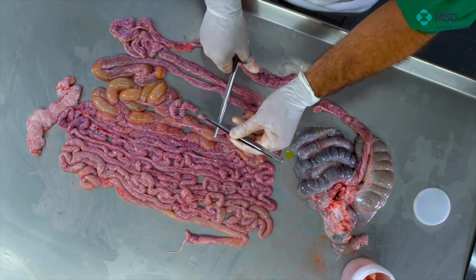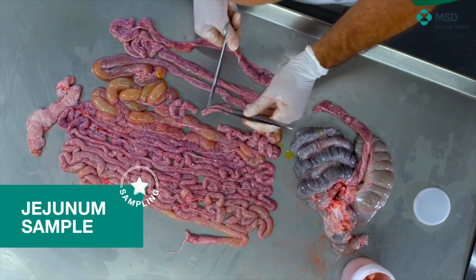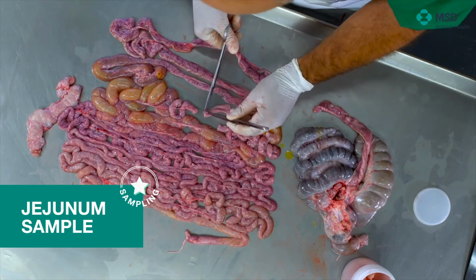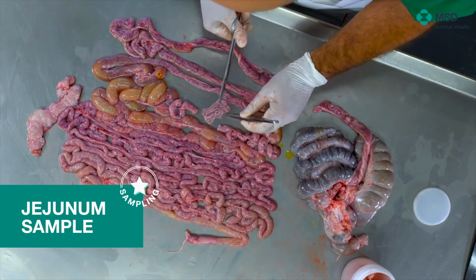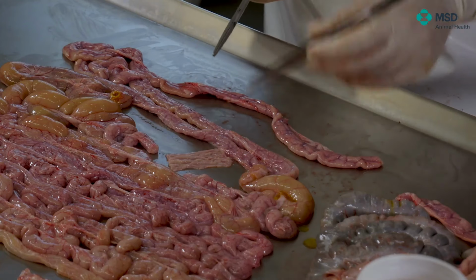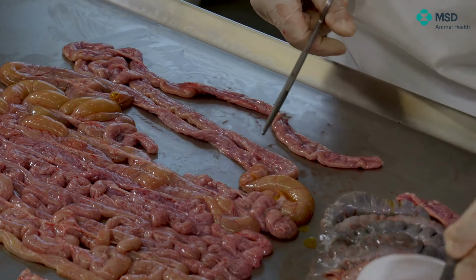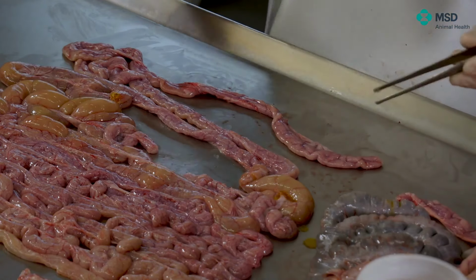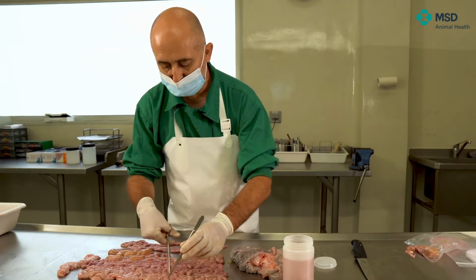We can take a couple of parts of the jejunum. Here we will do exactly the same. So we will open longitudinally, 4 or 5 centimeters in length. Look at here. Here we do not see any part which is thicker than other. So it's much thinner than the ileum, and implies that this is jejunum already. So we can put one piece of jejunum. Of course, since the jejunum is quite long, we can take several pieces.